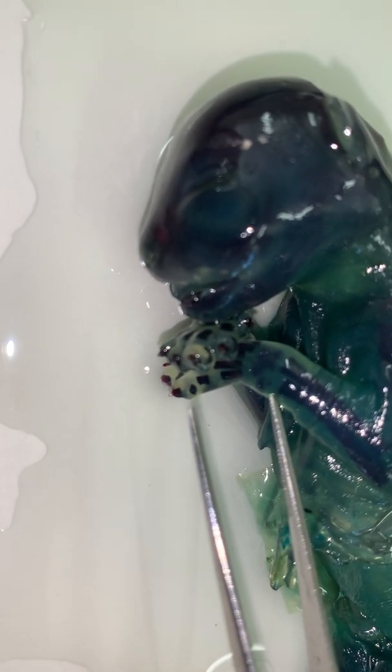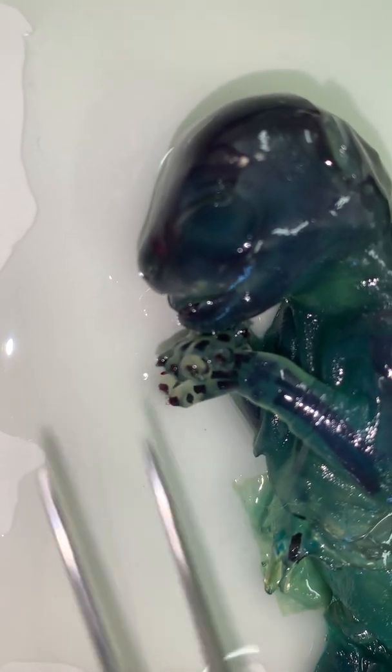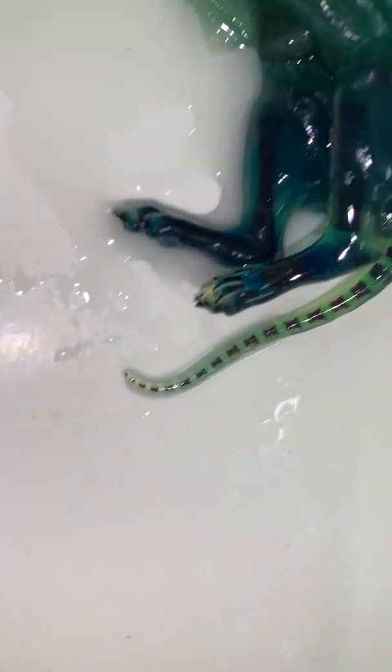And we're looking at the top of my forceps there. The epiphyseal plate, which is also the metaphysis of the bone. So these are cartilage replacement bones. So the cartilage forms an initial model and then is replaced by bone. And we see that also in the hand bones. We see it in the vertebrae over here.